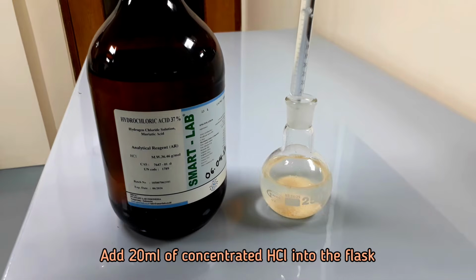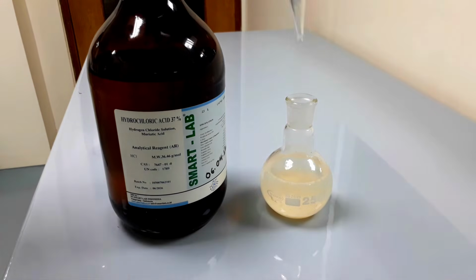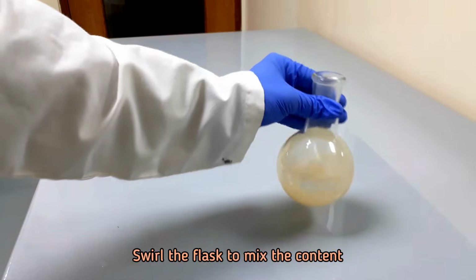Add 20 ml of concentrated hydrochloric acid into the flask. Swirl the flask to mix the content.